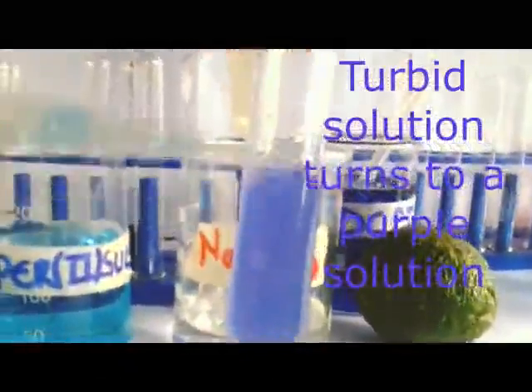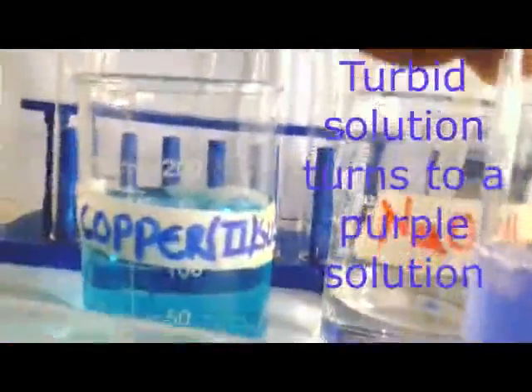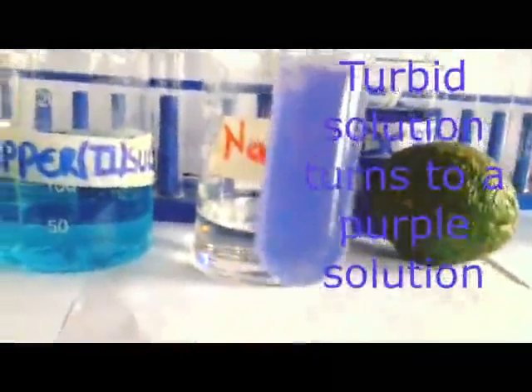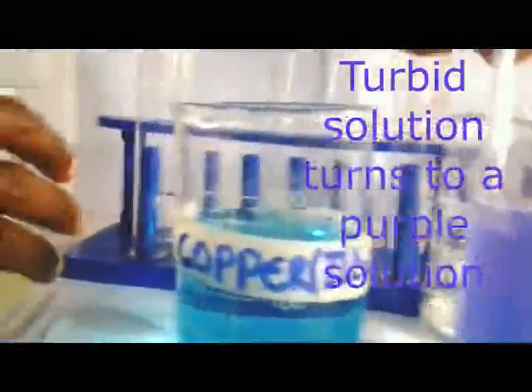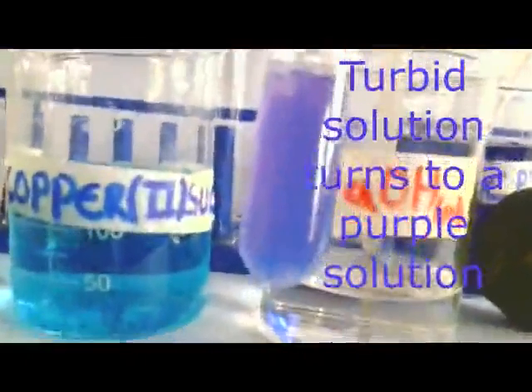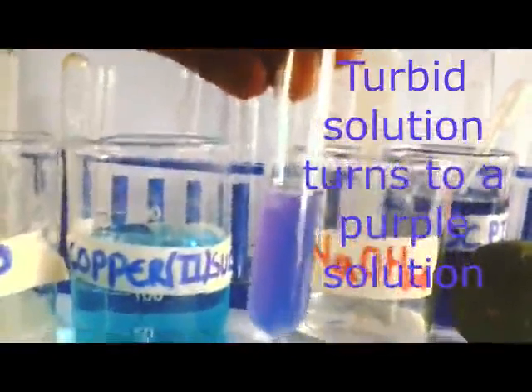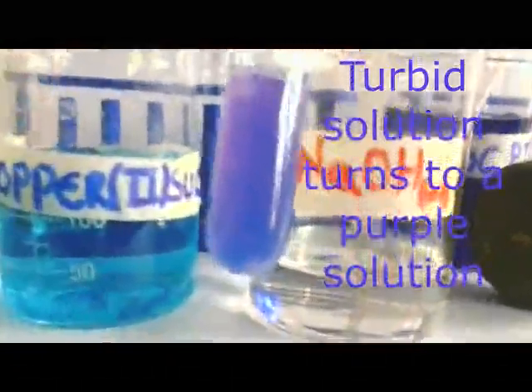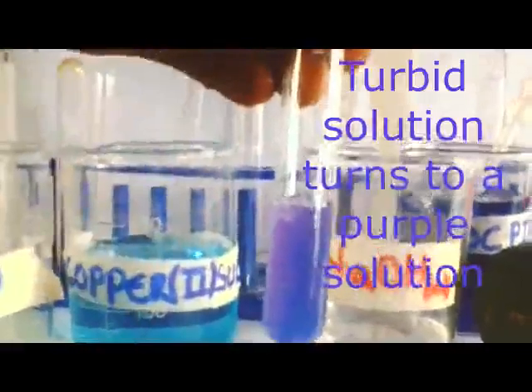So what are we going to write as our observation, members? We are going to write that a turbid solution, our solution P, turns to a purple solution. If you don't say purple, you can say violet, but don't mix them, purple or violet. You pick one. Now, our conclusion, our deduction, is: proteins present.